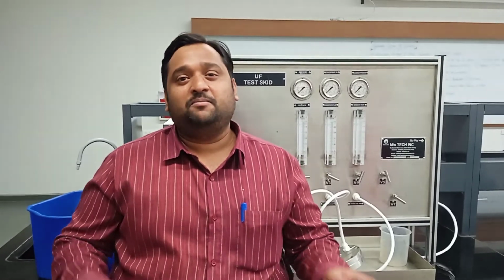I hope we have reached the end of the experiment. Today we have learned both modes: filtration mode and backwashing mode. Make sure you follow all the necessary precautions while performing this experiment, and operate the equipment as I told you. Thank you very much. We will meet with another equipment soon.